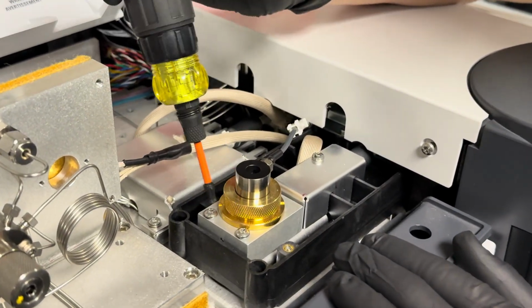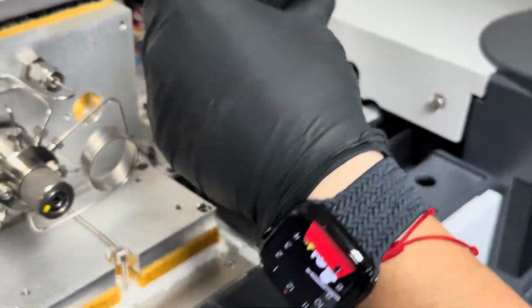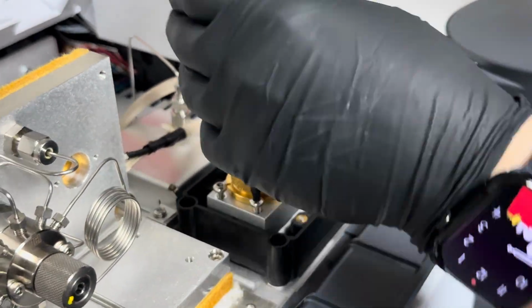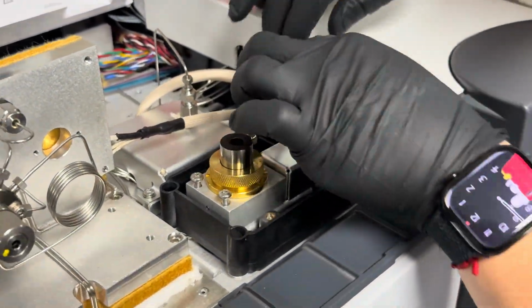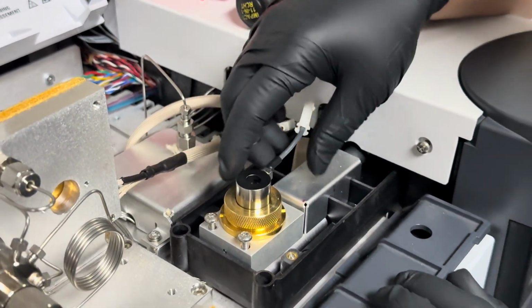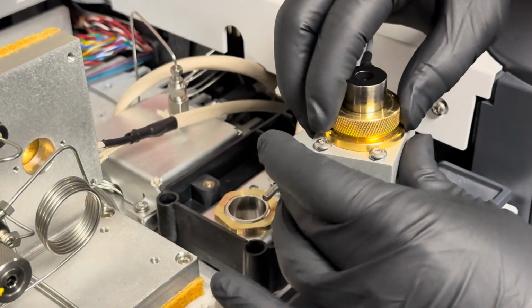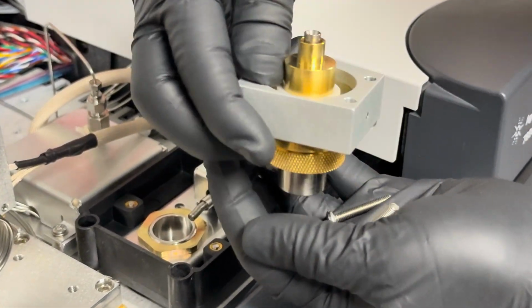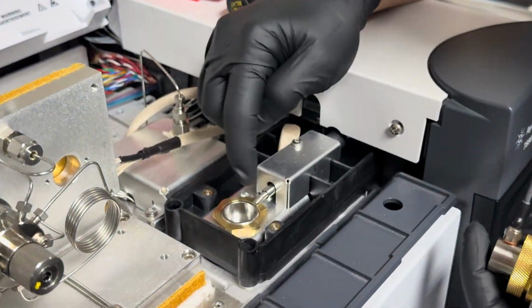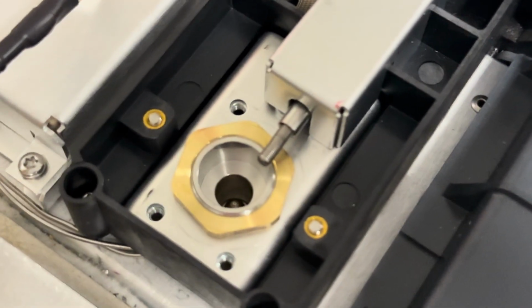So you have 3 screws that are Torx 20. You start by removing those. Once you loosen those, you unplug the igniter cable from there and gently prop this up, and you could take off the screws, set them to the side, and now you can see the spring and the flame jet down in the FID.